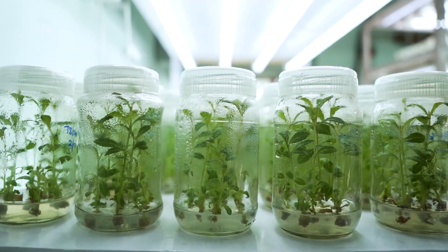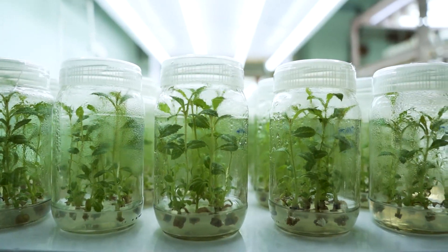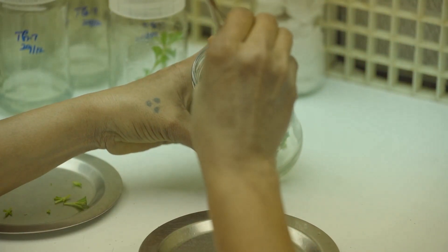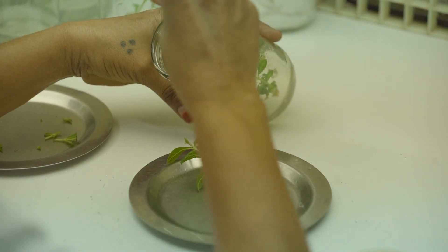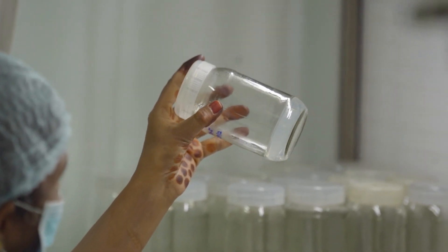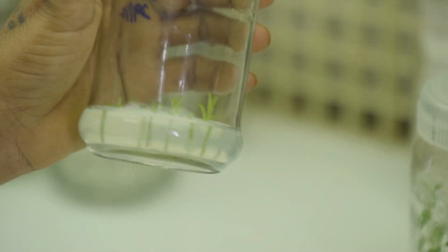In 45 to 60 days, new shoots emerge from the nodes. These elongated shoots are further excised into nodes and transferred to another nutrient medium for shoot elongation.